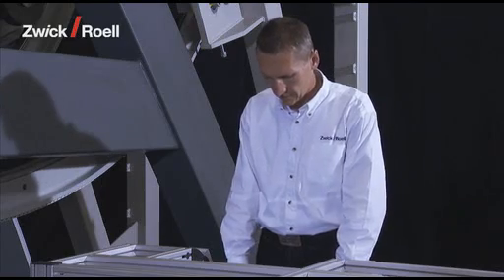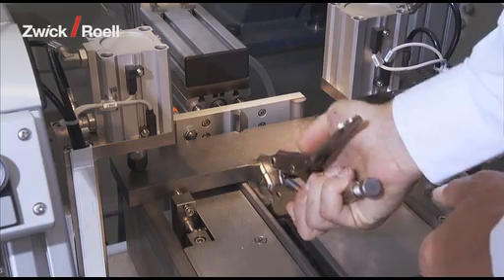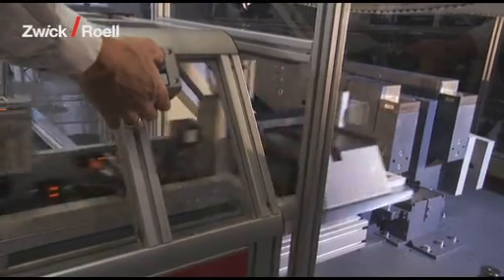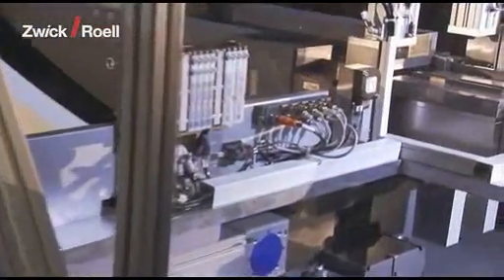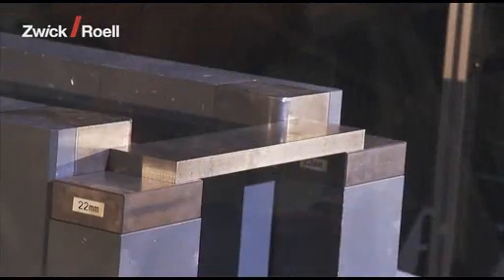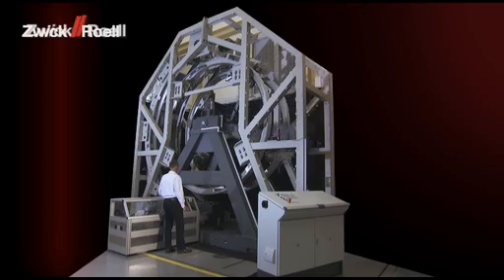The chilled specimen is then inserted into the Pendulum Impact Tester via the feeder unit, centered on the support fixture, and the test is started. In accordance with the test standard, the entire sequence is completed within 10 seconds.